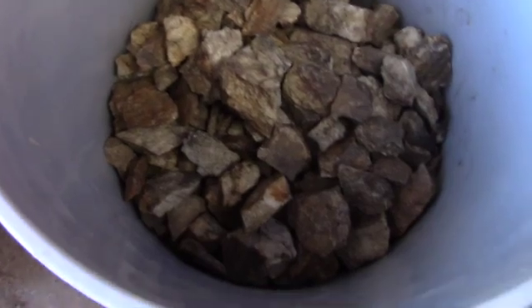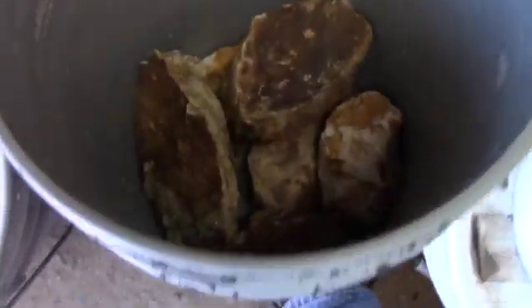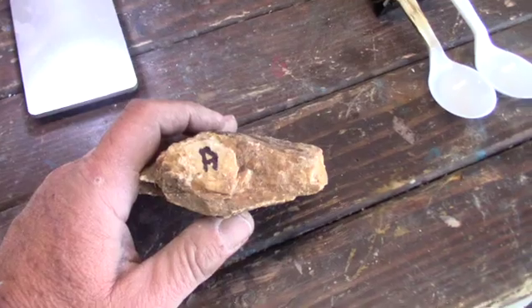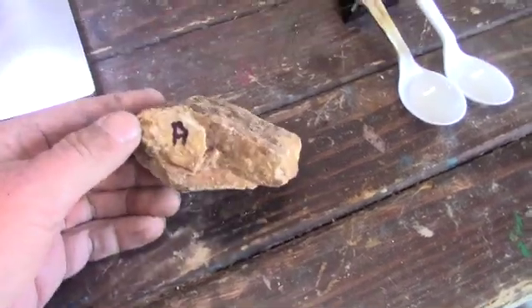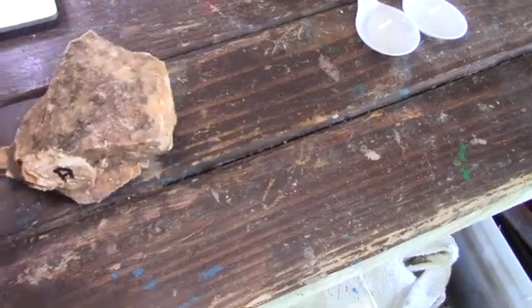Another sample with the smaller rocks in it, we'll call that sample B. And of course, the third one with the larger rocks in it, we'll call that sample C. Here's the first rock we're going to look at. This is out of sample A, of course. Usually rocks don't come with letters pre-stamped on them. So we'll look at that under the microscope and see what we get.